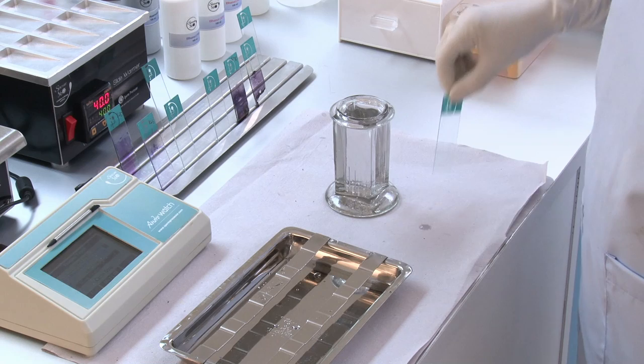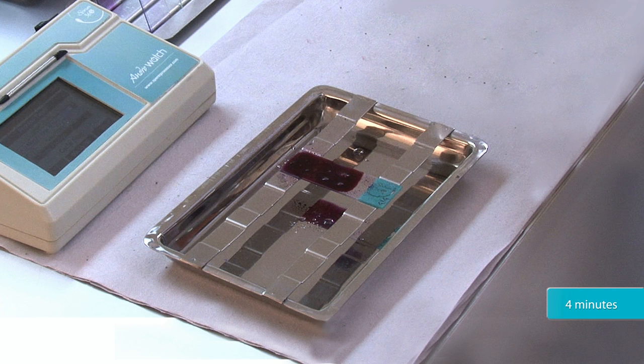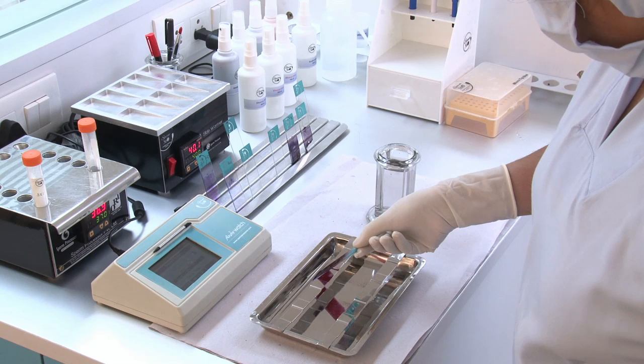Drain off the water. Keep the slide horizontally on a staining tray. Cover the smear with Harris's hematoxylin and keep it for 4 minutes.